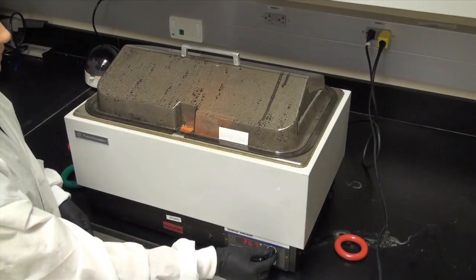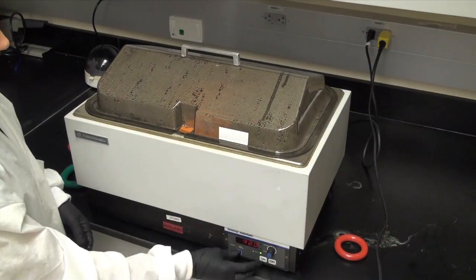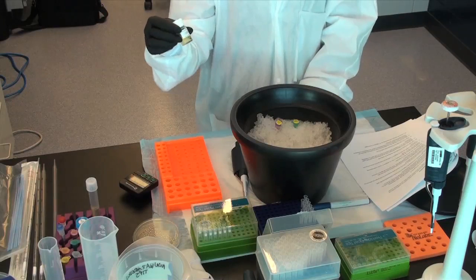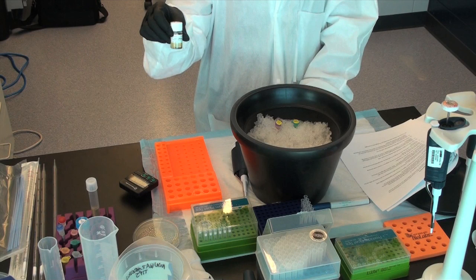Step 2: Equilibrate a water bath to 42 degrees Celsius. Step 3: Warm one vial of SOC medium, super-optimal broth with catabolite repression, nutrient-rich bacterial growth medium with added glucose, to room temperature.